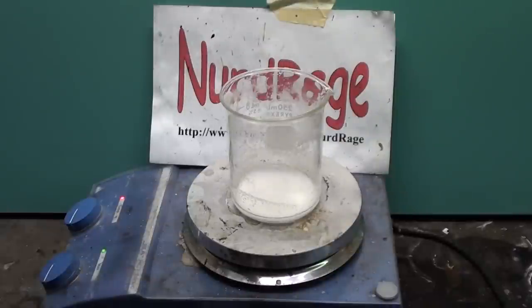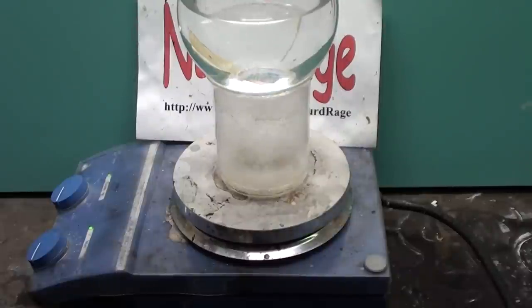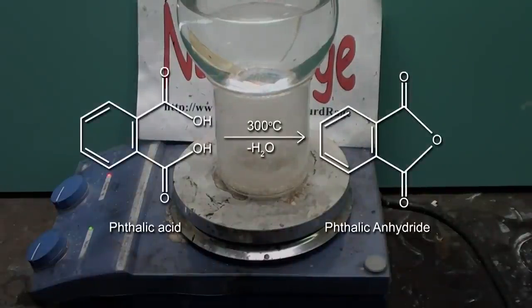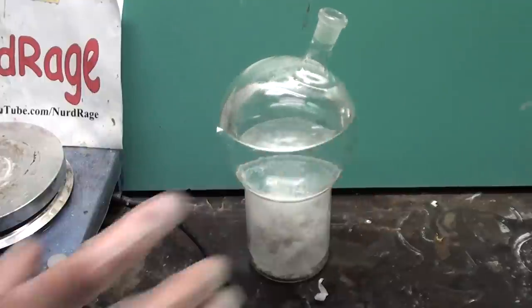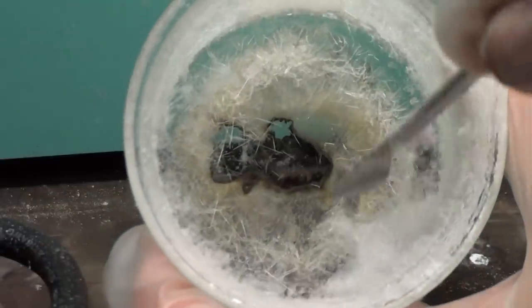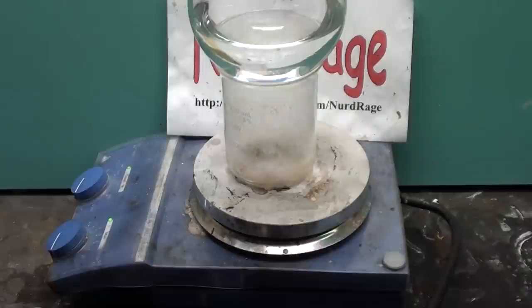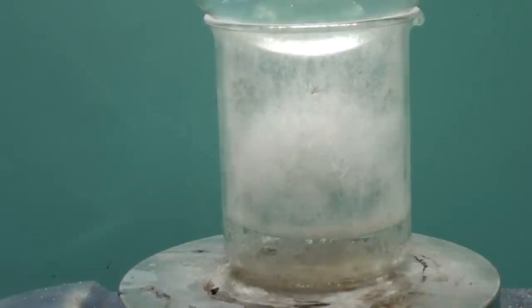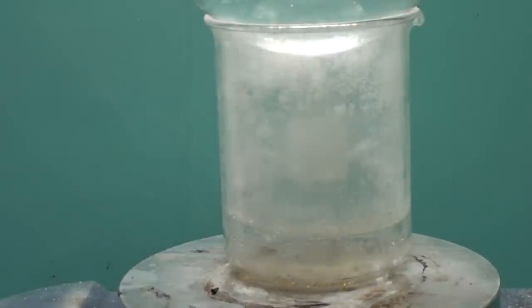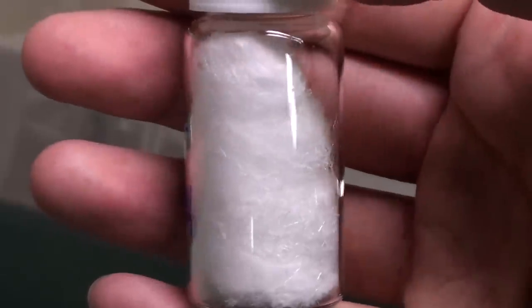Place the phthalic acid on a hot plate and heat it to boil off the water. Eventually the phthalic acid will dry and melt again as the temperature increases. At this point, place a flask of cold water over the beaker. The phthalic acid will dehydrate into phthalic anhydride and boil off, where it condenses on the top flask and sides of the beaker as crystals. When a good amount is deposited, take it off heating and let it cool. You can see the cotton candy-like deposit of phthalic anhydride. Carefully scoop out just the phthalic anhydride, being careful not to contaminate it with impure material at the bottom, and place it into a vial. Go back and vaporize and collect more phthalic anhydride until very little comes out. Be careful not to wait too long for it to deposit, or the deposit will get so heavy that it falls back onto the bottom. Eventually with enough collection you'll get a sizable quantity of pure phthalic anhydride. If your yields are low you'll need to convert more gloves before continuing.